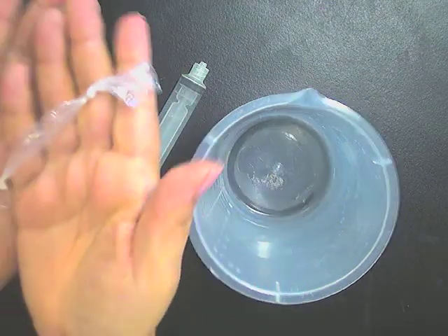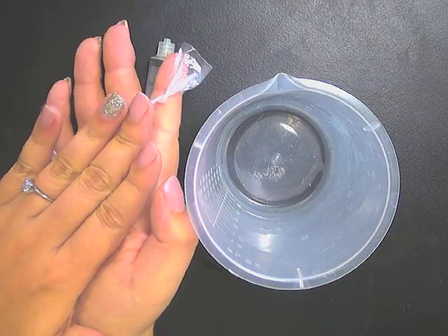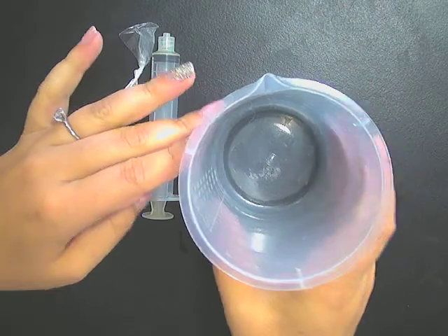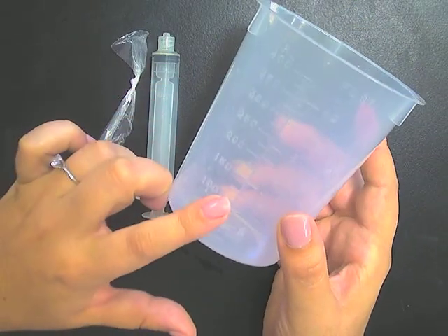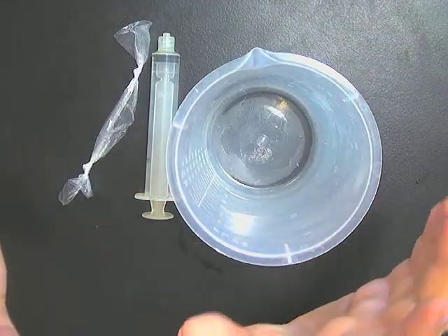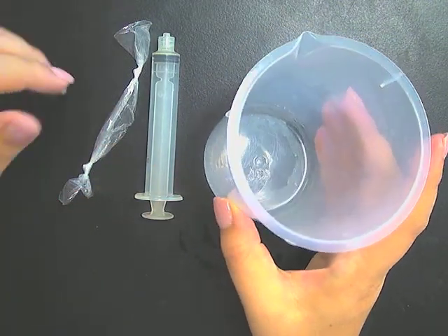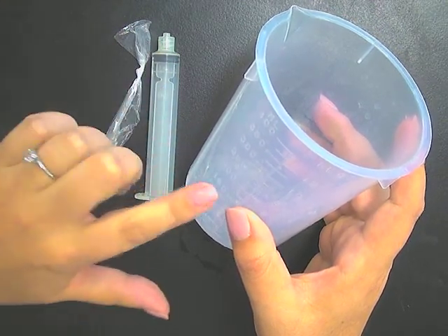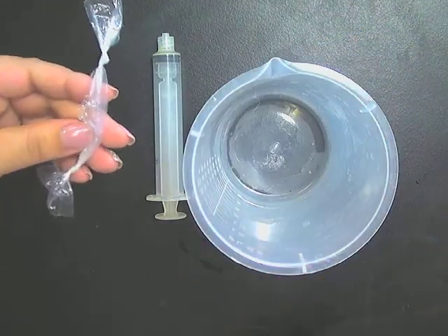Then you're going to take the mass of this solution sausage. You'll record the initial mass, and then you're going to submerge it in about 250 milliliters of plain water. For our control, we're going to compare how the various sucrose solutions change mass, or their percent change in mass, based on how much water they gain. So we need to compare it to something, which is our control. Our control is going to be just a tube filled with water.